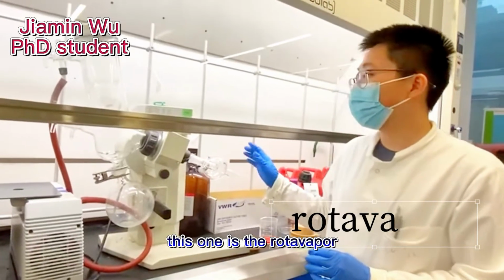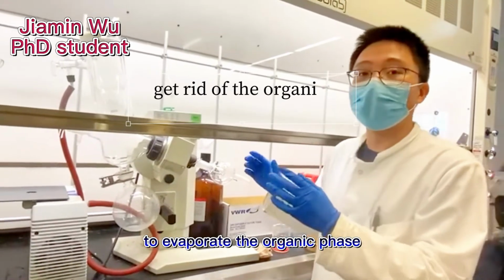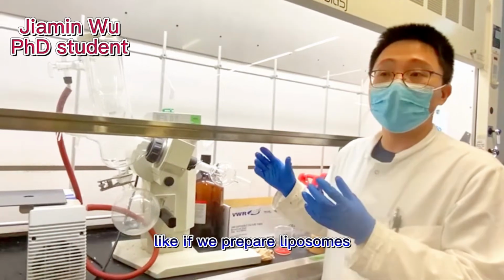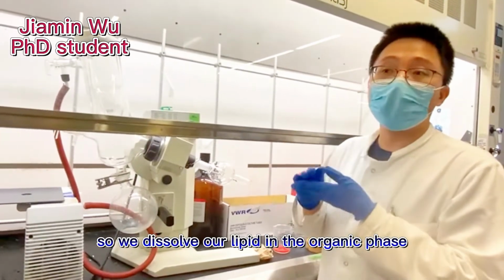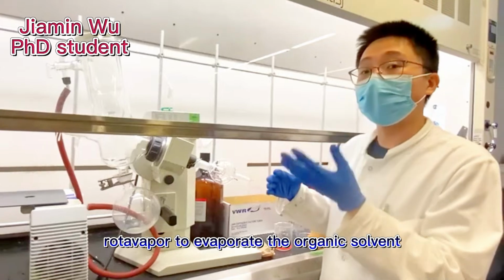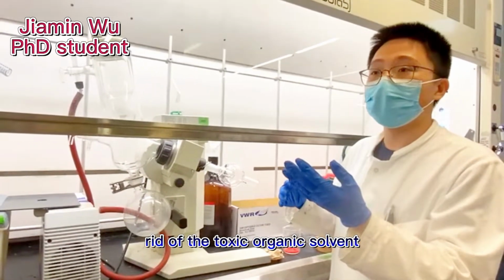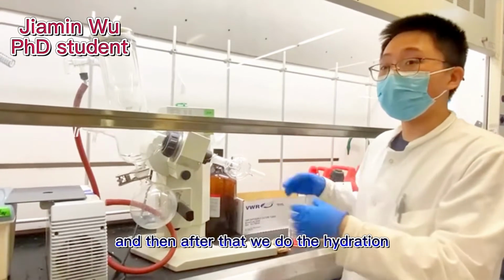This one is the rotavapor. Usually we use this rotavapor to evaporate the organic phase in our drug solution. Like if we prepare liposomes, we need to have a thin film. So we dissolve our lipid in the organic phase, and then we use this rotavapor to evaporate those organic solvents so that we can get rid of those toxic organic solvents. And then after that we do the hydration to get our nanoparticles.